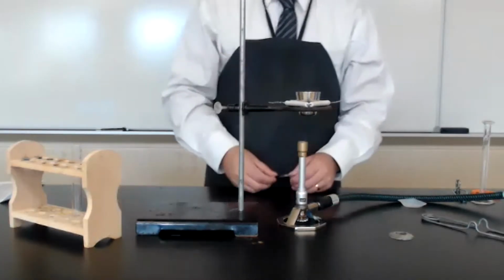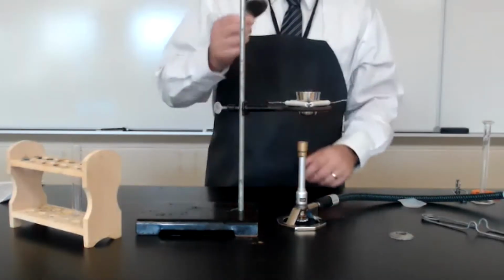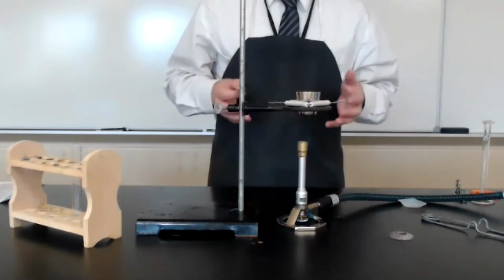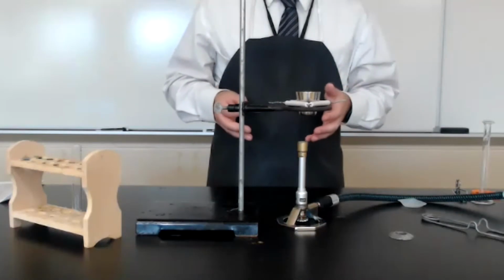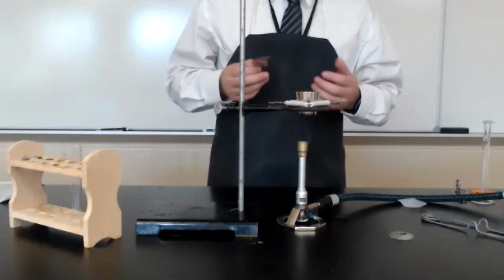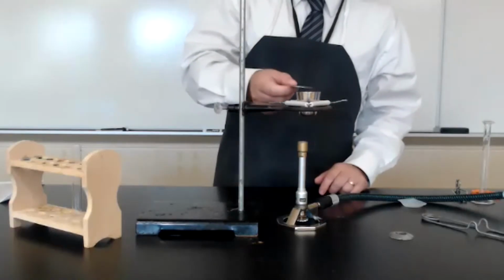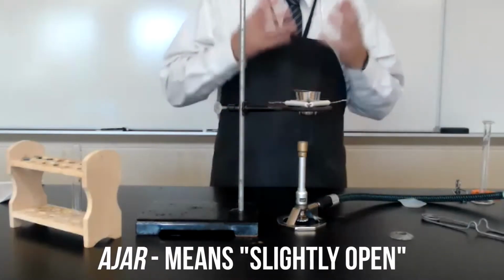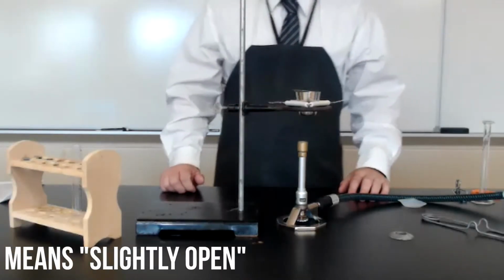When we're heating the crucible, we want to make sure to cover it with a lid, but don't cover it completely, because that will prevent the water that we're trying to drive off from escaping. So instead, place the crucible lid on the crucible ajar, allowing a small space for the evaporated water to escape.